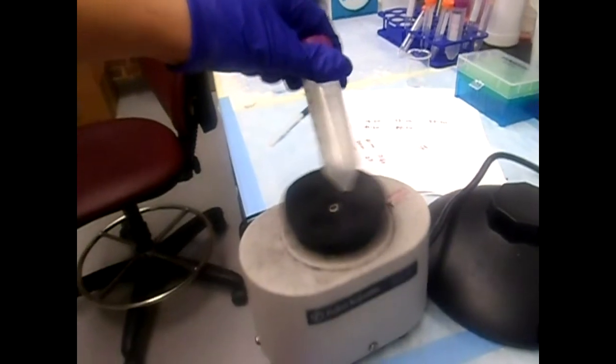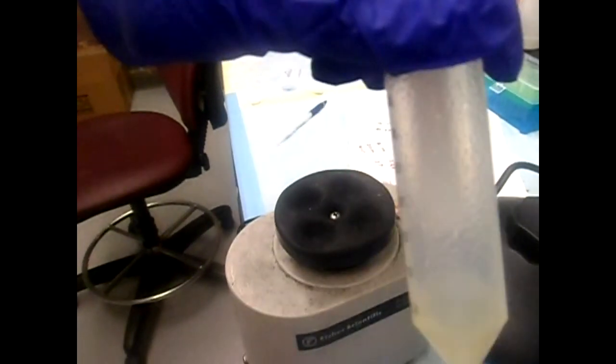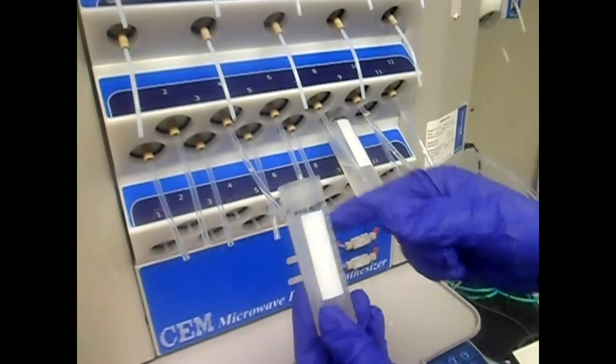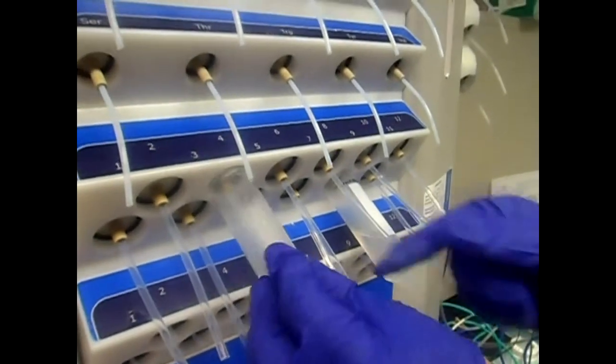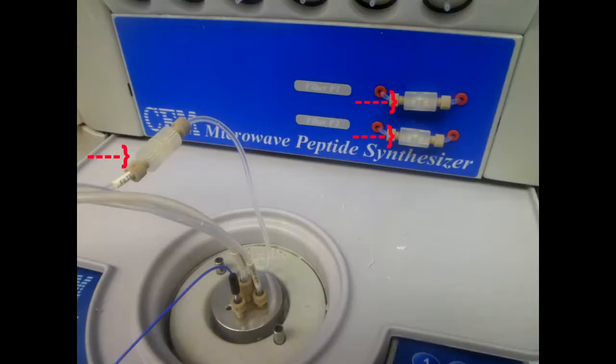The resin is also loaded onto a plastic tube and solvated with NMP. These beads are insoluble and swell up in the solvent. The resin is attached to the resin feed tube without a filter, since the resin needs to be transferred into the reaction vessel. After a few runs, 3 inline filters have to be switched out in order for solvent to flow smoothly. These filters are screwed in from each side.